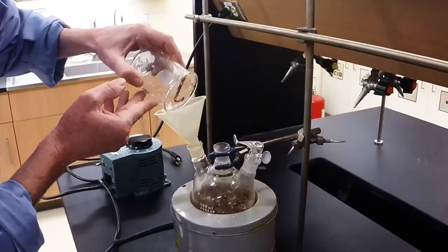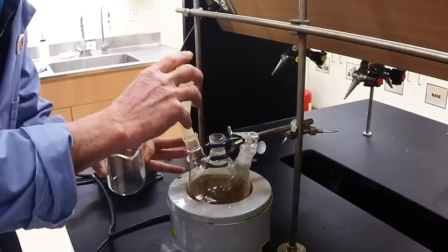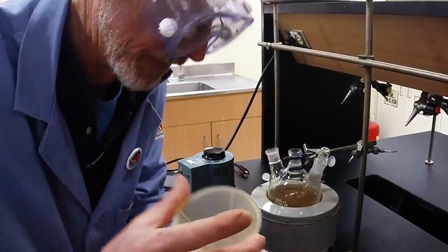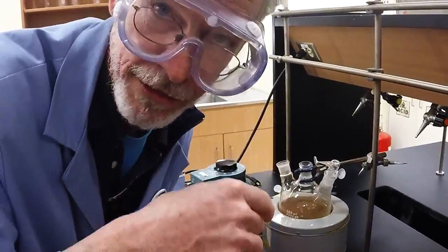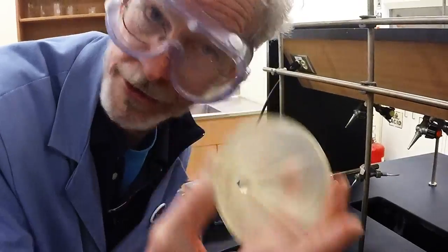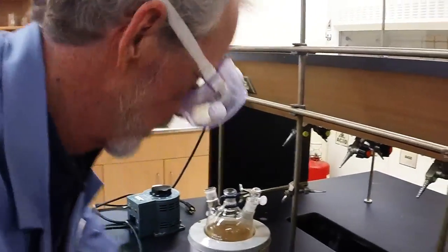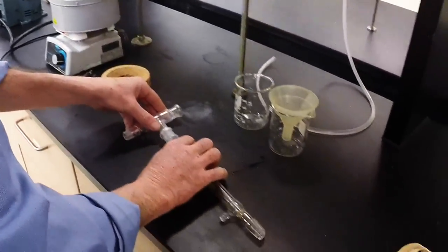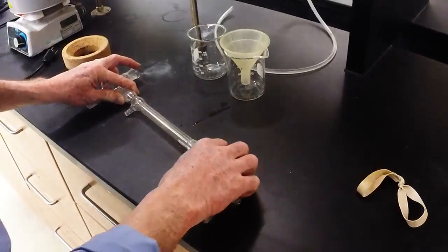So I like to have a little water first, then the clove. Wash in the rest of the cloves. This is a powder funnel — it's got a big hole. Don't try to use a skinny funnel to put a solid in; use the powder funnel. There we go. Another stopper goes in.